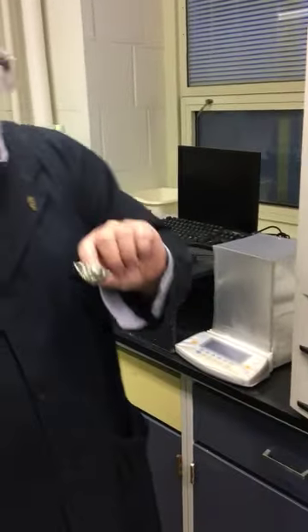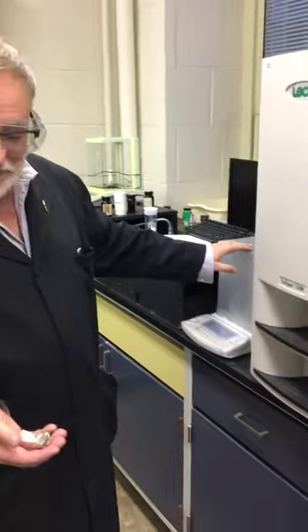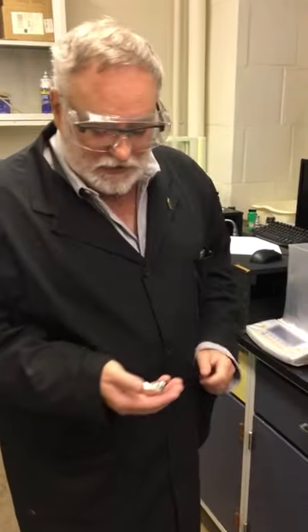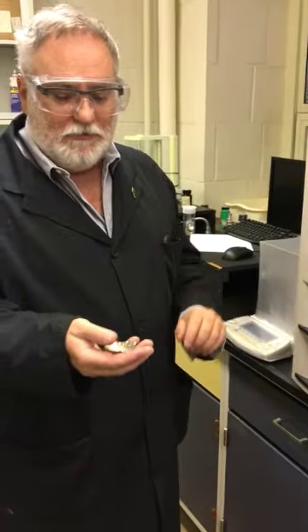Again, balance, a foil sample holder. If I was doing this for real, I would be wearing gloves because I wouldn't want my oils to contaminate the data. It would sit in this balance, which is again high precision, high accuracy, 5 decimal places. We would weigh to 4 decimal places, push a button, it gets transferred to the computer. We know the mass of the material.